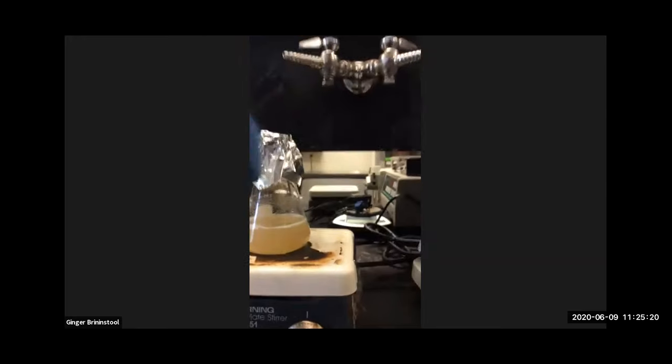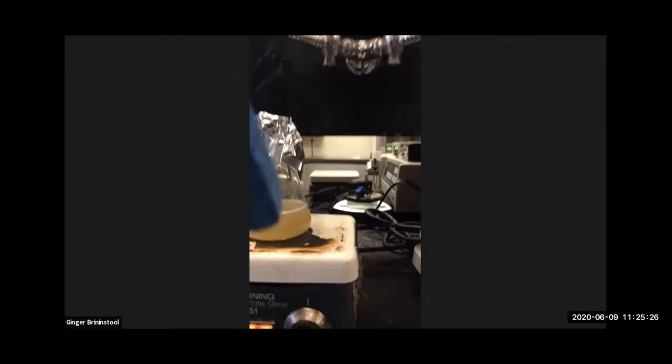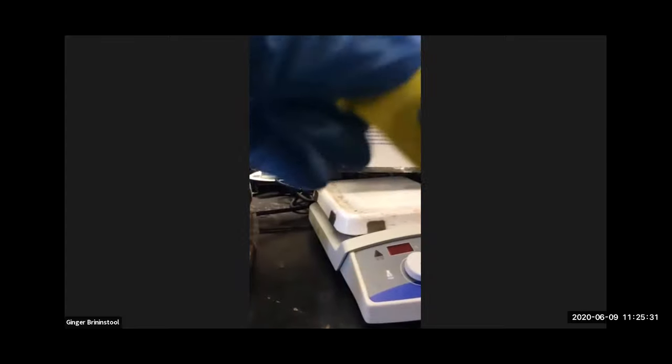While that's happening, we need to do a couple other things, though. We need to label that flask, and to do so, we need to get a piece of tape and a marker. Now, when you're labeling, I got a very, very tiny piece of tape. I don't know what I was thinking. Normally, you should write out the full name of the growth medium. I'm not going to have room for that, so I'm just going to write NA, nutrient agar. Normally, you should write nutrient agar all the way out.